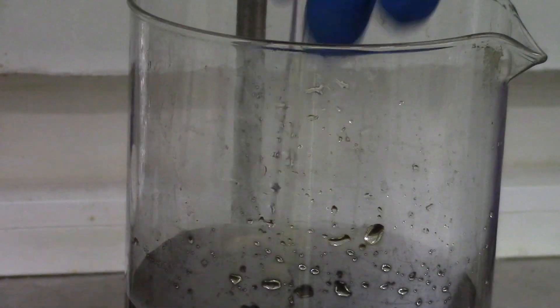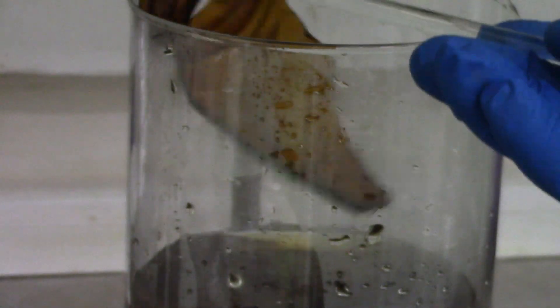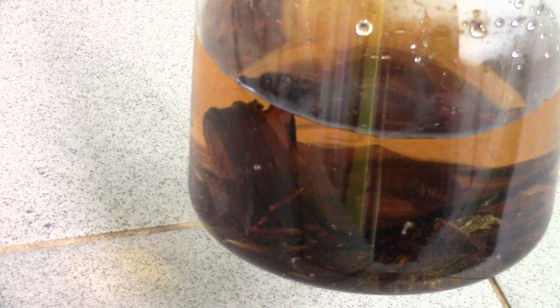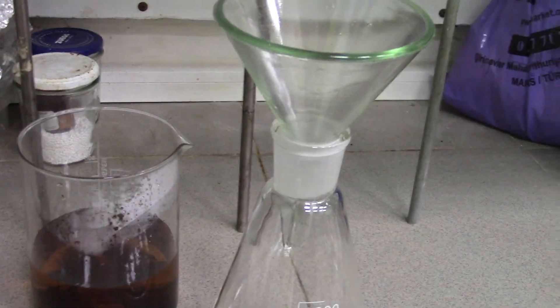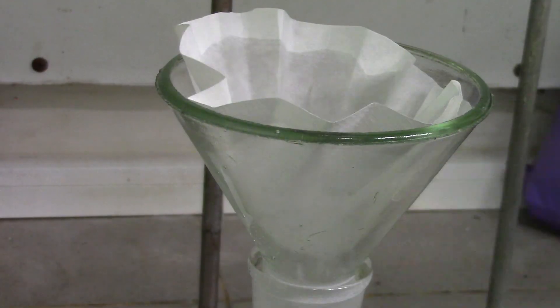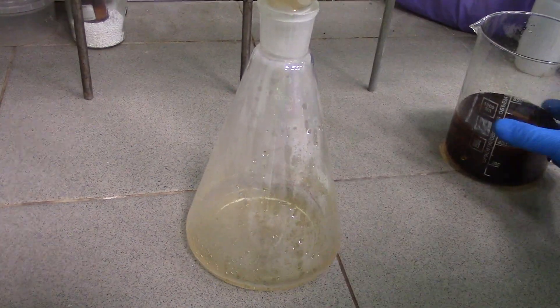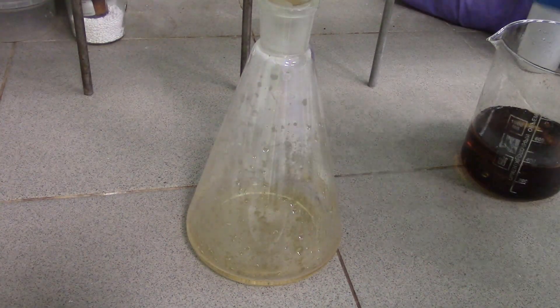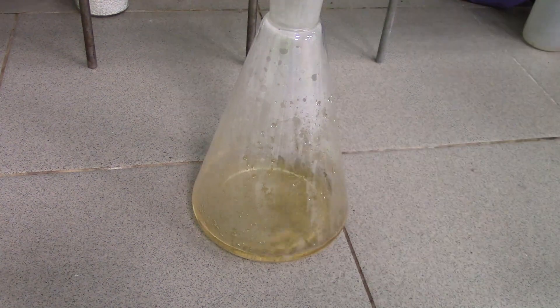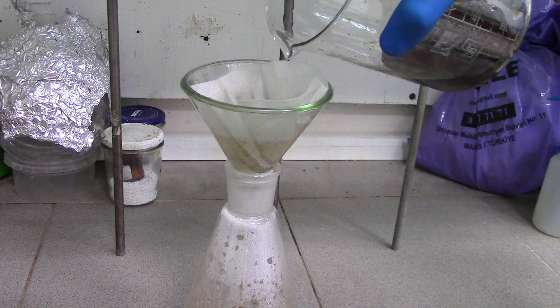After 15 minutes, all palladium went into solution. I filtered it off using filter paper into an Erlenmeyer flask and washed my beaker a couple of times with distilled water.